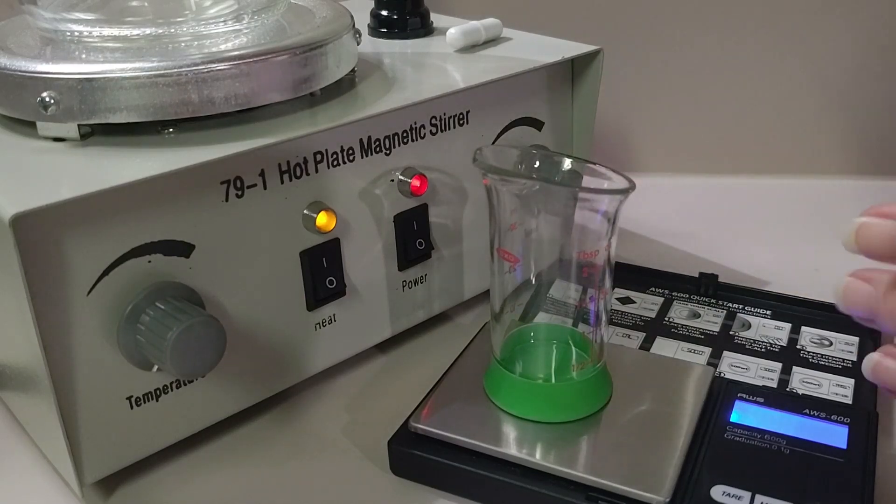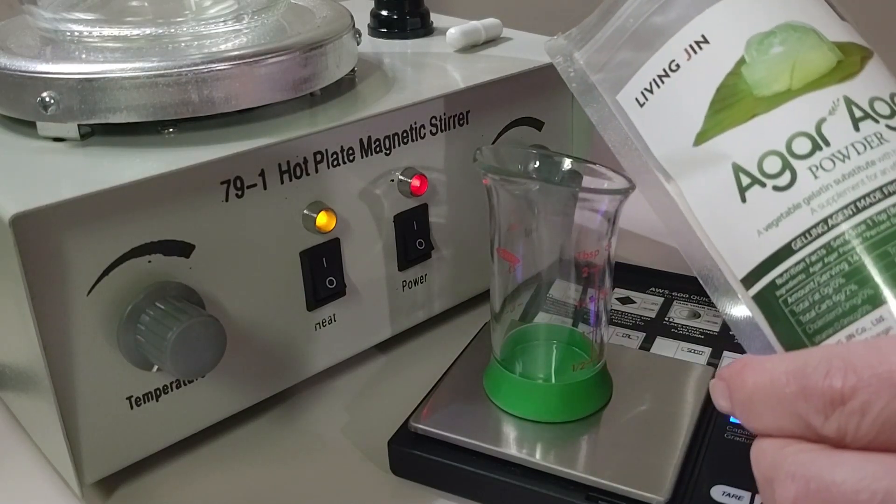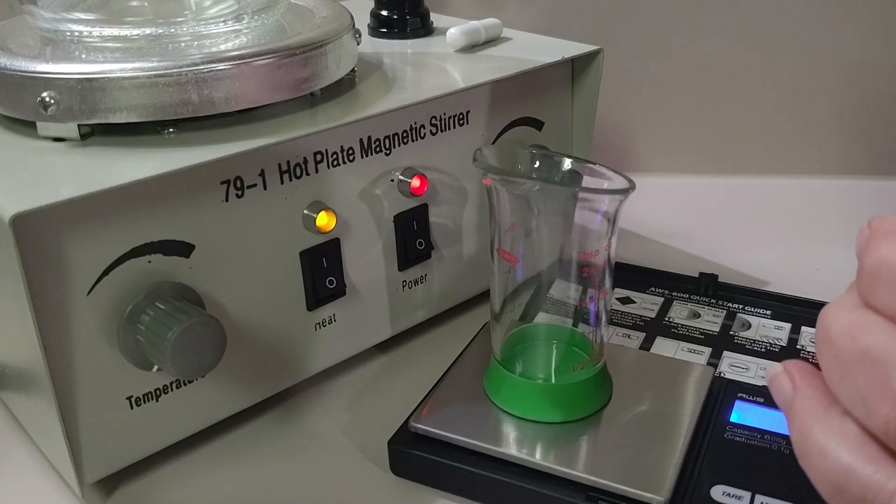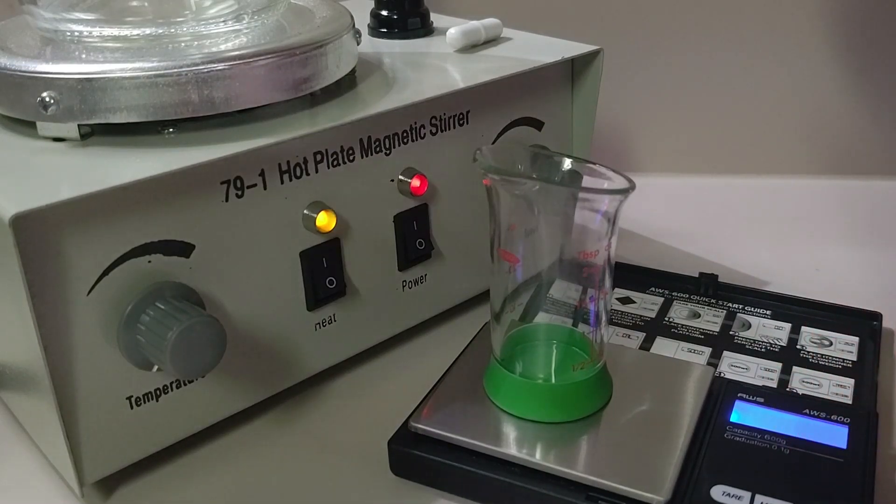Spores are inherently dirty so utilizing agar techniques allow the home mycologist to clean out any contamination before moving on to the next step of grain spawning.